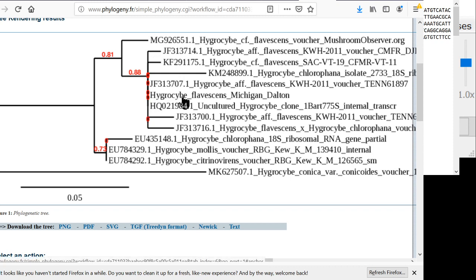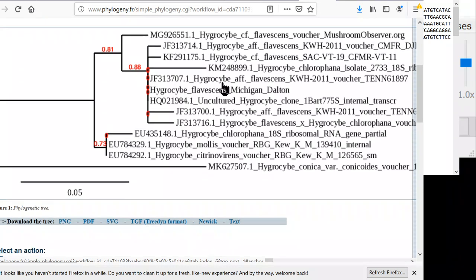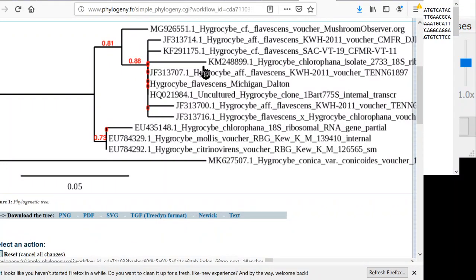My sequence here is this one, Hygrocybe flavescens, Michigan, Dalton. Everything on the same branch here is the same species. This one here is probably a dirty sequence of the exact same thing. But this one here is my sequence from California. So you can see that the closest sister species is this species from California that looks the same but isn't.